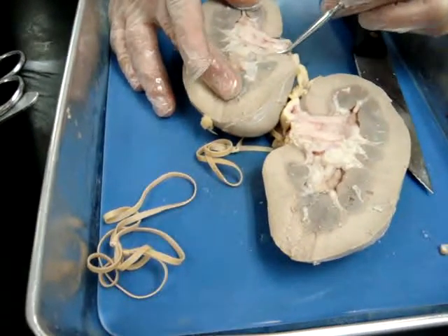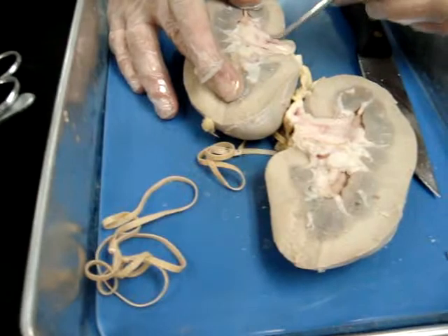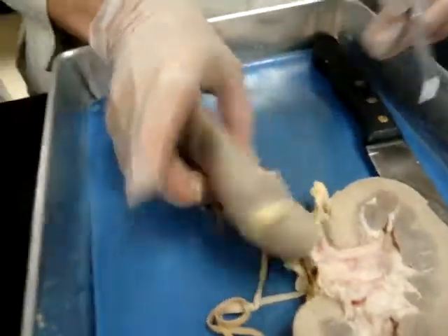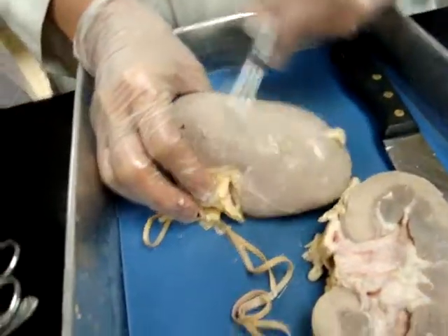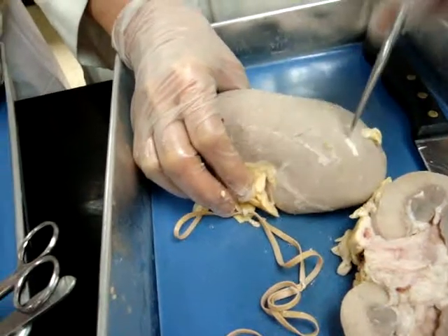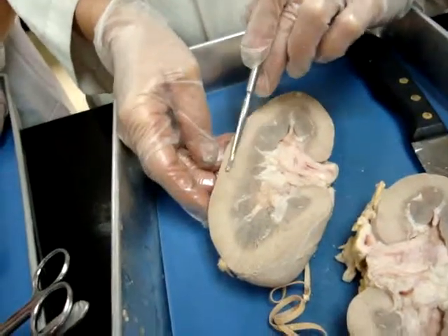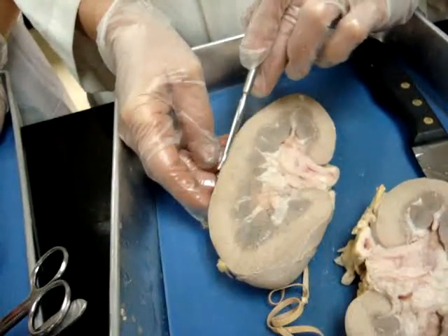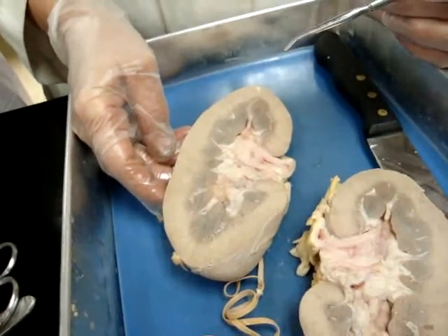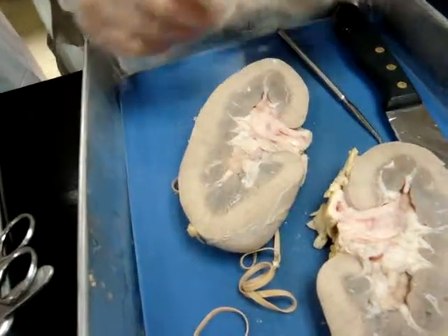So the hilum — from here to here — or hilus, here to here. What else do we have on here? The capsule — this stuff out here, that's the capsule, this hard stuff out here. And the cortex — you said it was the light brown? Cortex is the light brown, the upper portion here.